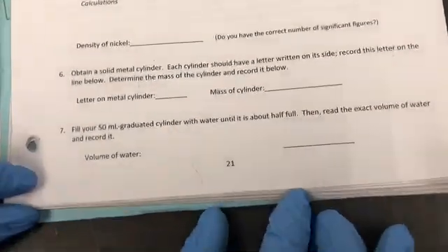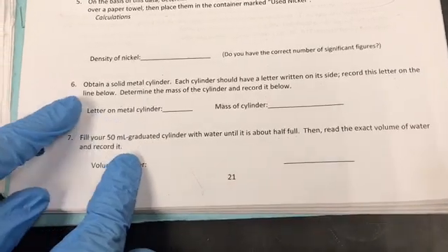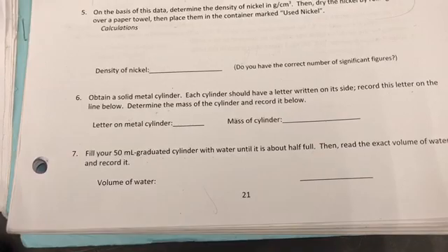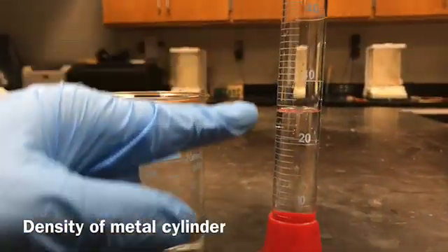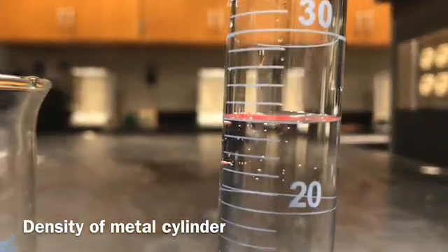All right, now we're going to start working on the density measurements for the metal cylinder. So now I have added 25 milliliters of DI water into the measuring cylinder. You can note down the reading.